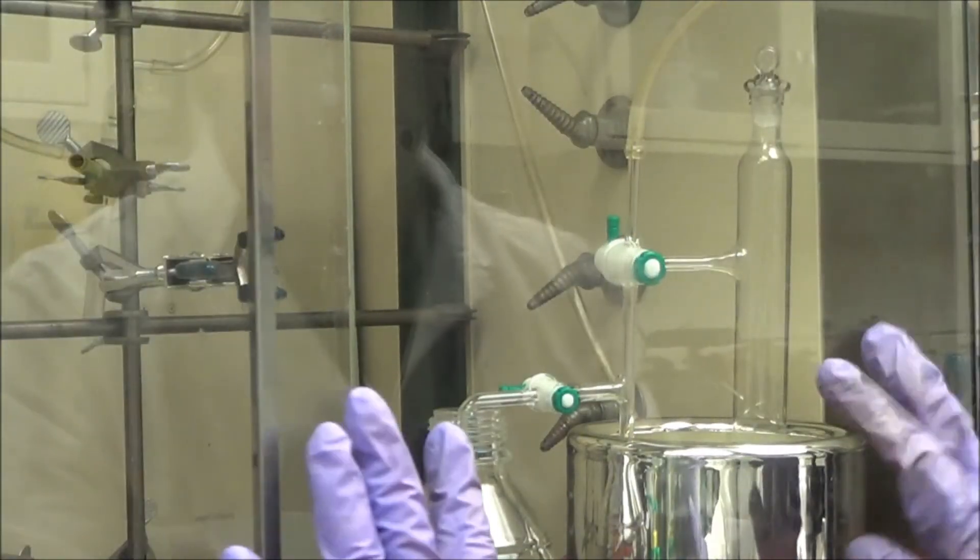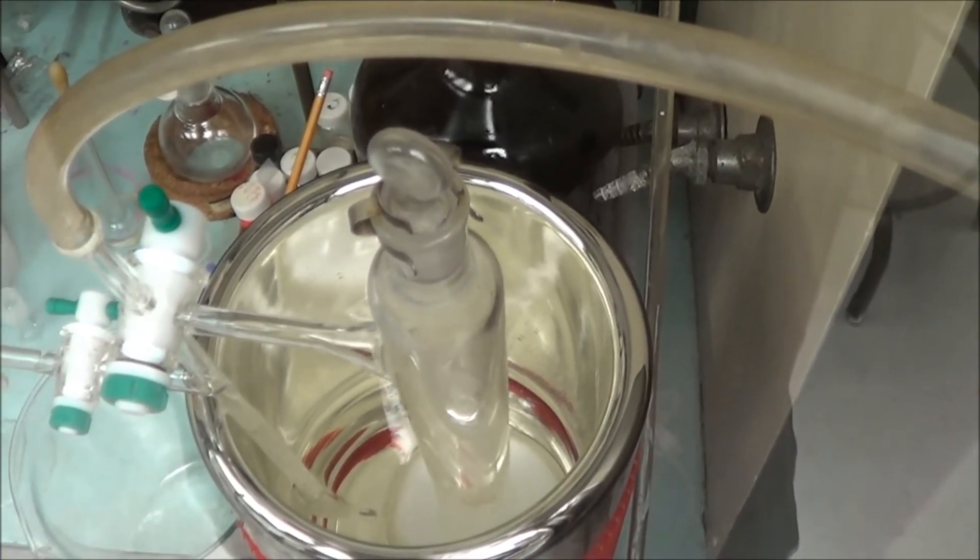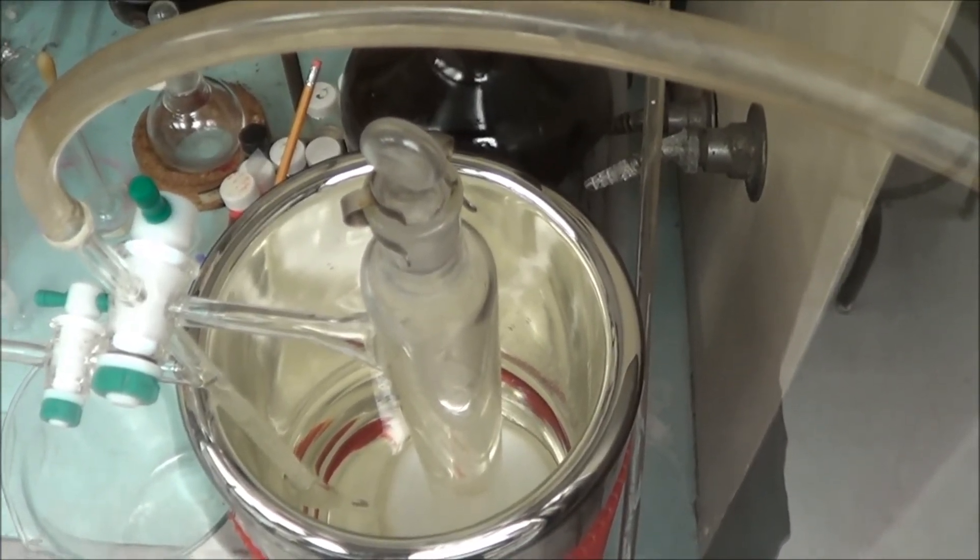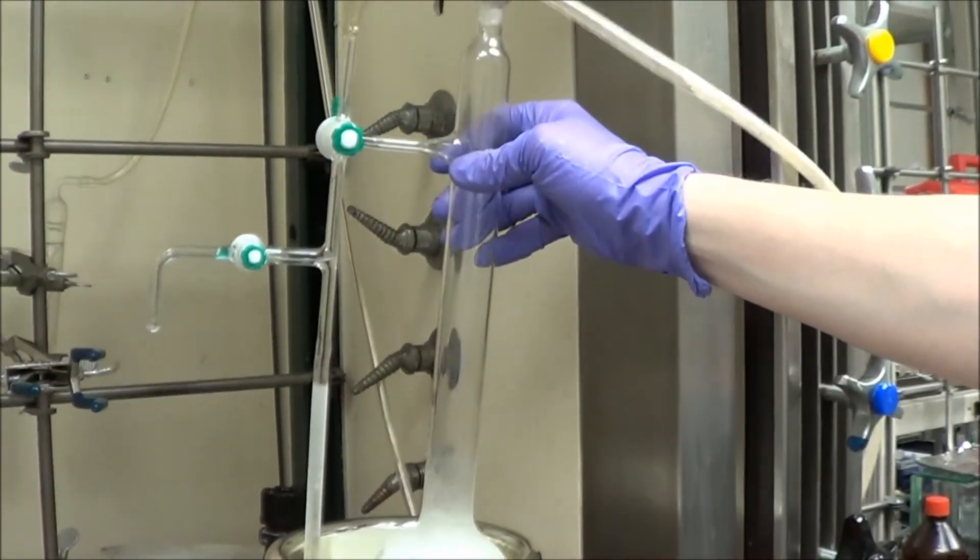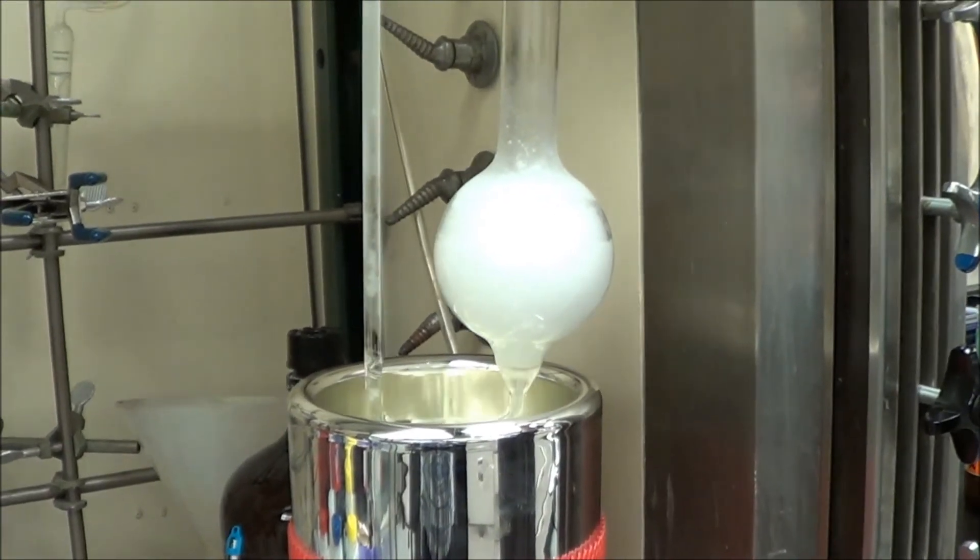After about 20 minutes, half an hour has passed, I feel like the system has equilibrated. You can see the oleic acid stuck to the sides. And here I'm just going to let it take it out for a minute so you can see the acetonitrile slowly coming up the left-hand stem.